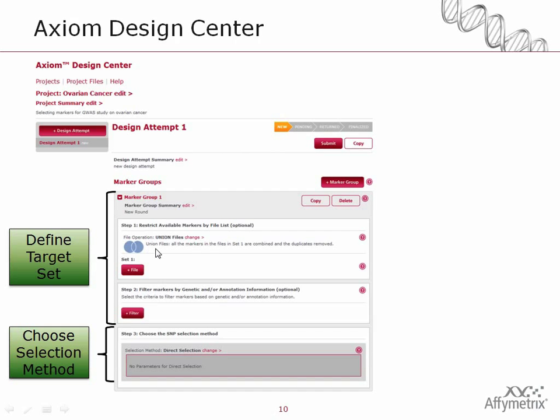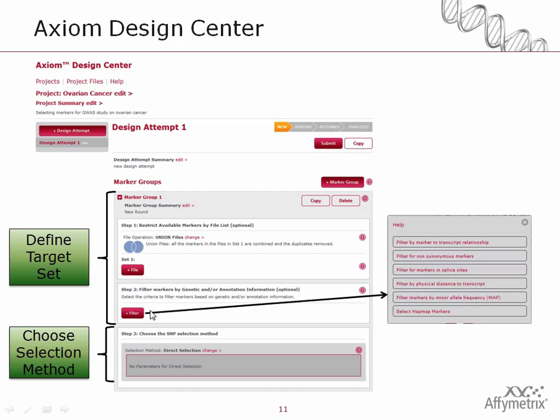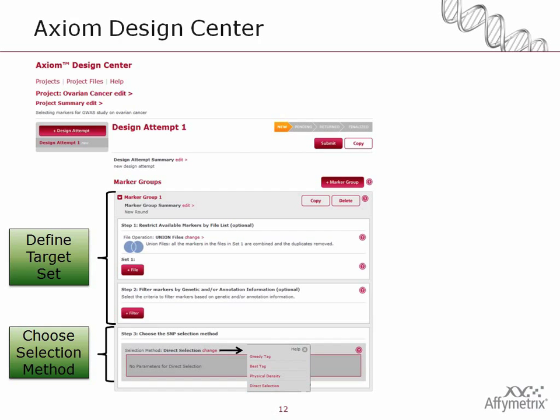You can see step 1 is where you pick any files of interest. Step 2 allows you to filter, as I said, to refine your target set of interest based on the transcripts and the markers related to them, or other features of the markers themselves. Step 3 is where you actually select your selection method by clicking on the change button, and you can see there's a greedy tag, best tag, physical density, and the direct selection. Direct selection is indicated by default.